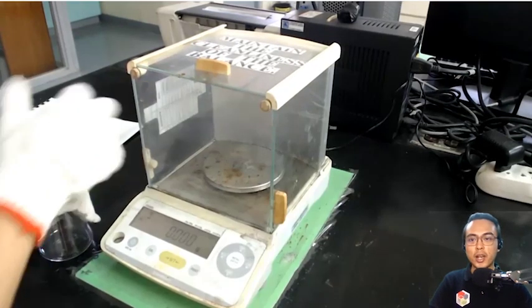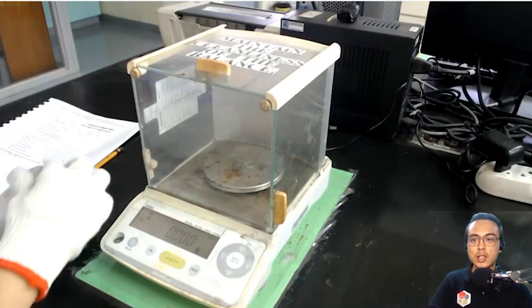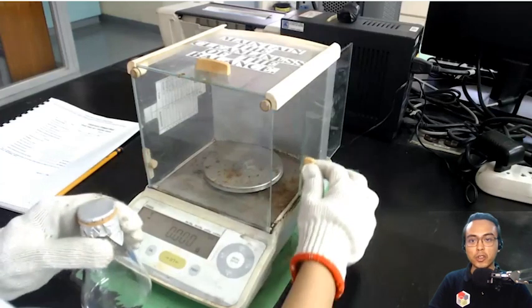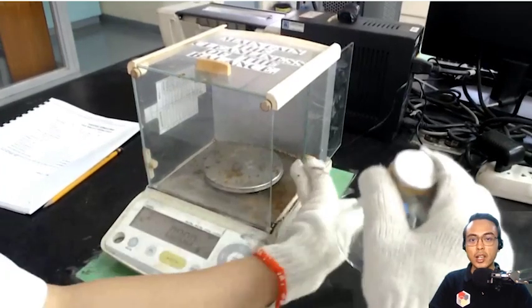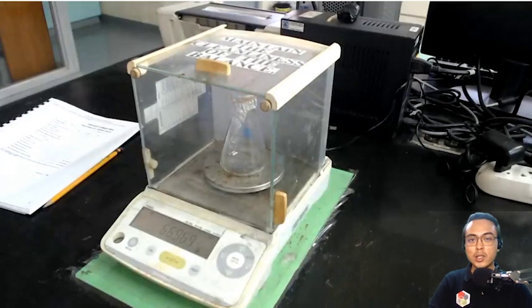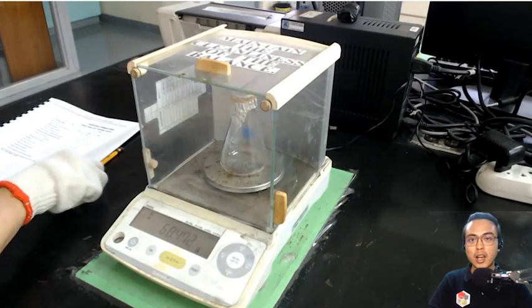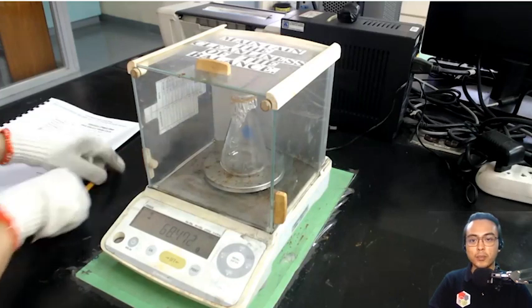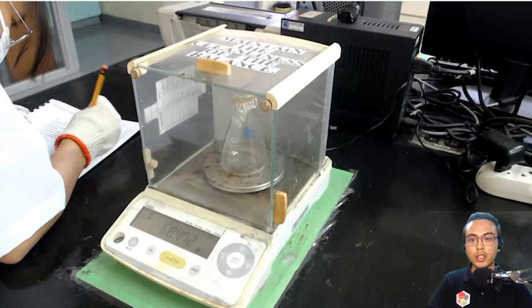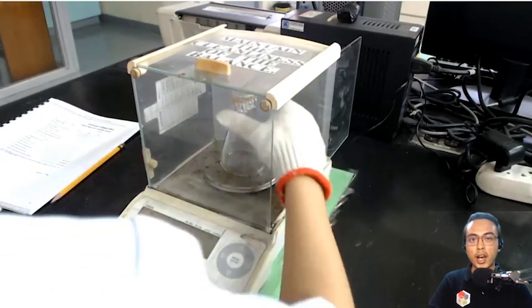After recording the mass of the flask, you see now that she is placing a sheet of aluminum foil at the top of the flask secured with a rubber band, and then we are weighing it again. We are interested in the mass of the flask plus the aluminum foil plus the rubber band because again we will be using that later to determine the mass of the remaining sample inside of your flask. And again, do not record the actual mass displayed here. You will be given the mass of the flask in the raw data.